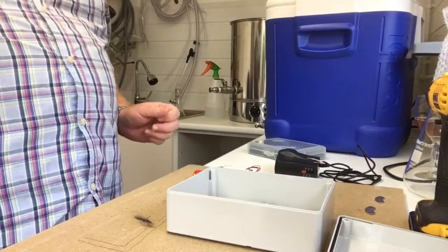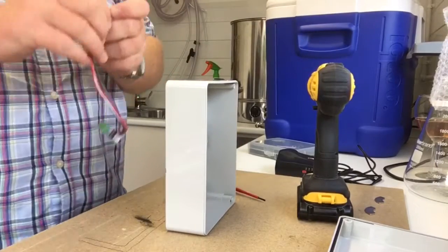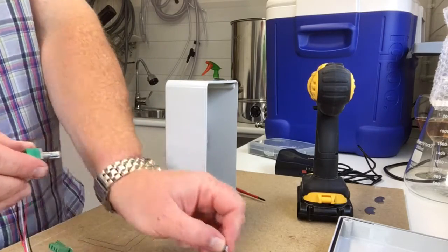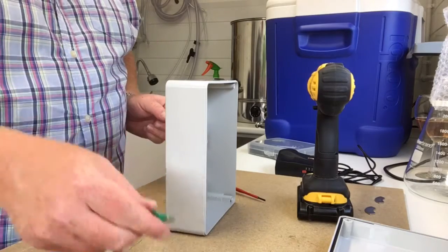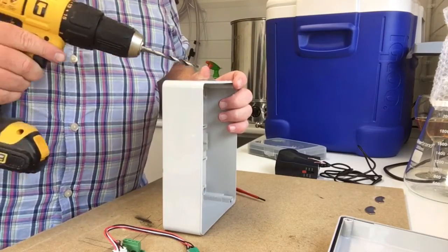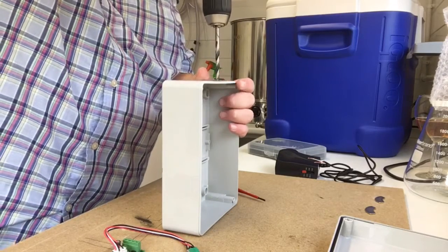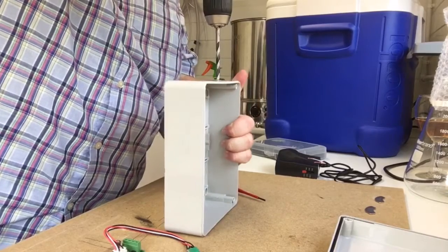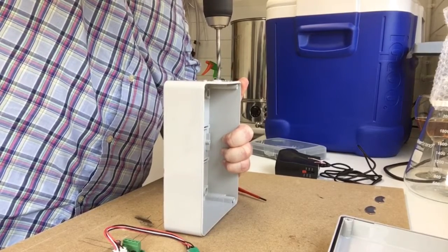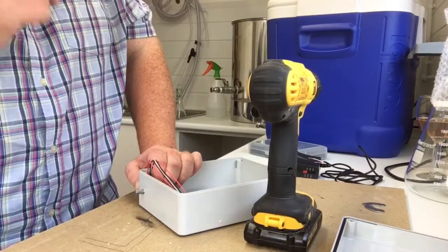Right. Okay. So, hole for the regulator. Straightforward. Drill bit's not the perfect size, but it will do. Middle, left, right, middle, left, right. Ugh, whatever, doesn't matter, does it? We'll stick it there. Sorry about that, messing around.